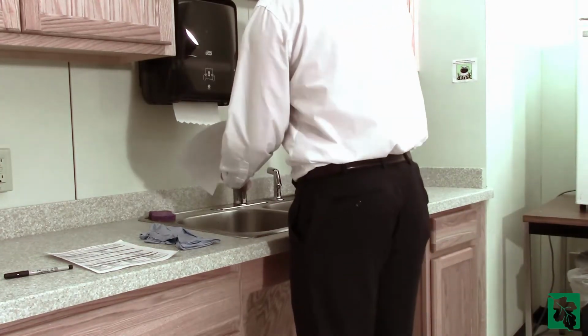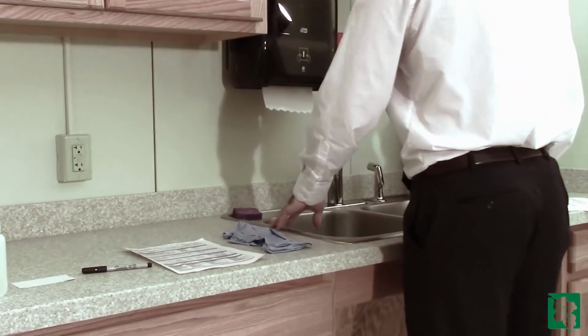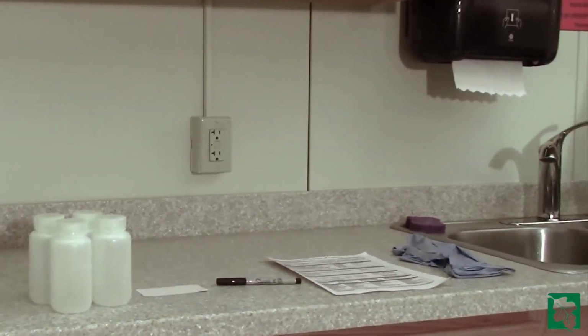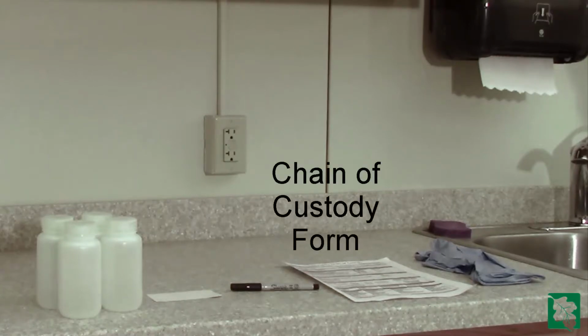On the morning of the sampling, perform a quick walkthrough of the facility to ensure no outlets were left running overnight. Begin preparing for the sampling event by having all the items that are needed to collect the samples: sample bottles, labels, a waterproof pen, and the laboratory chain of custody paperwork.